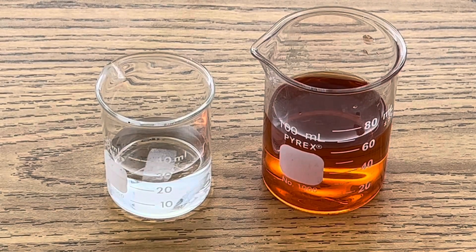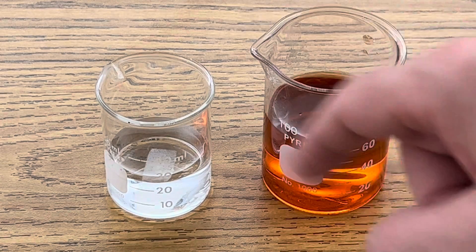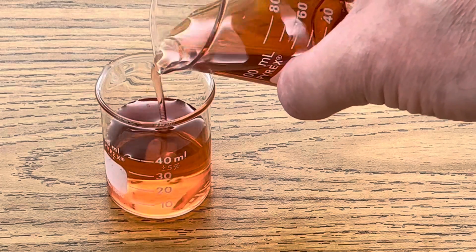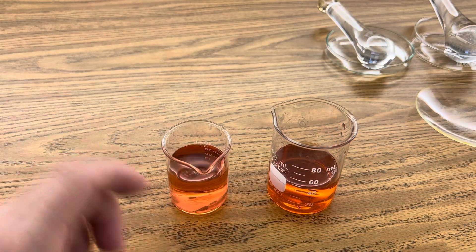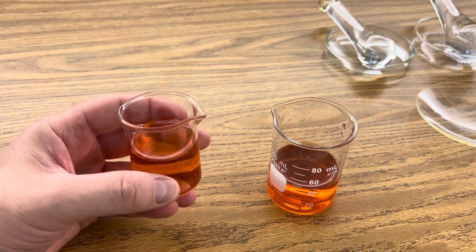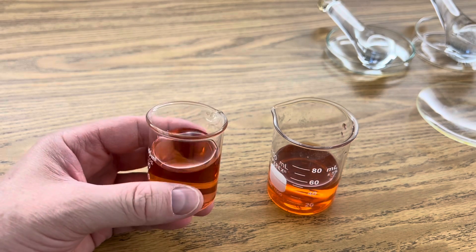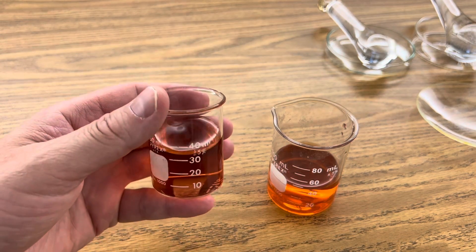Now in order to make Scott Reagent, I'm going to add 10 more milliliters of my aqueous solution of cobalt chloride to my 20 mils of my aqueous solution of potassium thiocyanate. And when I do that, I will create cobalt thiocyanate in a double displacement reaction. What happened is the metal ions traded places — the cobalt traded places with the potassium. So instead of cobalt chloride, now I have cobalt thiocyanate, and instead of potassium thiocyanate, now I have potassium chloride and water in this little beaker.